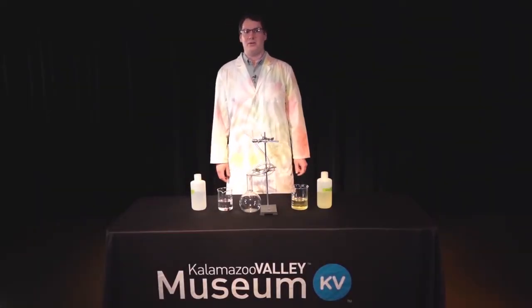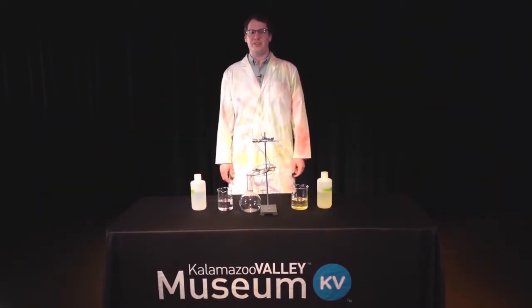Hi, I am Blake Tresca. I'm a professor of chemistry at Kalamazoo College. And the demo that I'm going to show for you today is chemiluminescence.